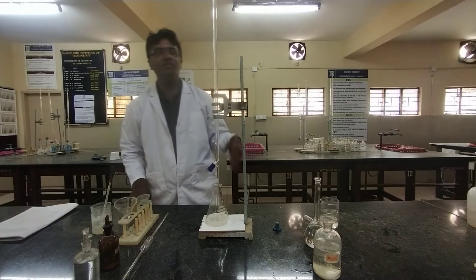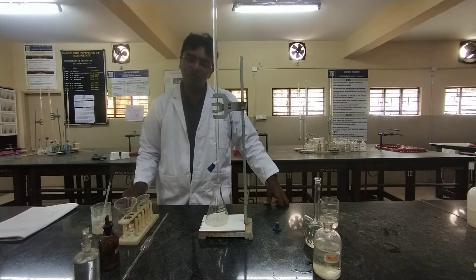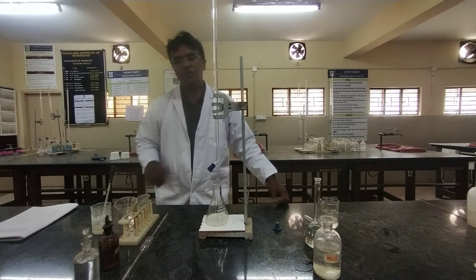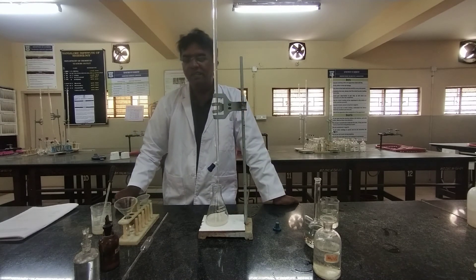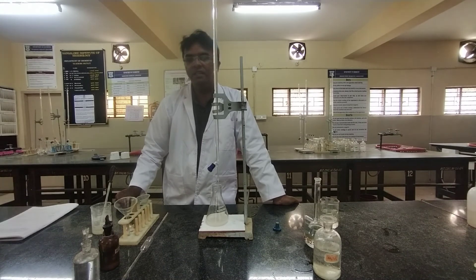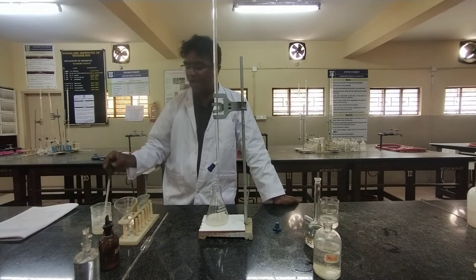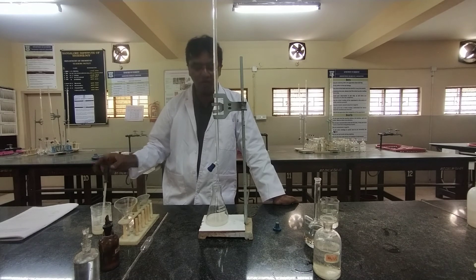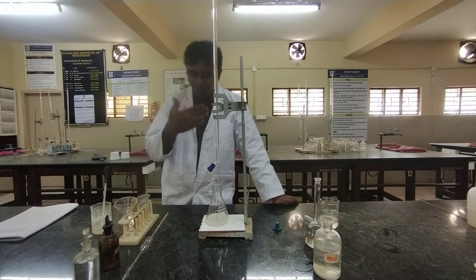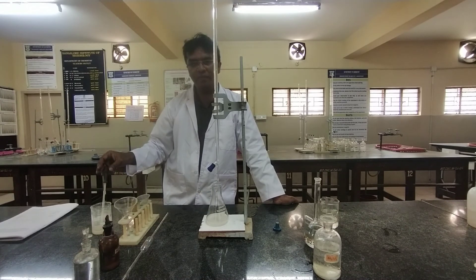You do 3 trials and take the least value to calculate further. You may wonder why in all other experiments the indicator is added at the beginning, but in this iodometric titration we add starch near the end point — only when the color becomes pale yellow.